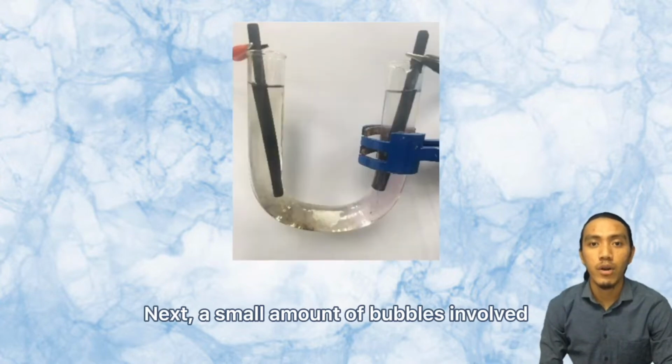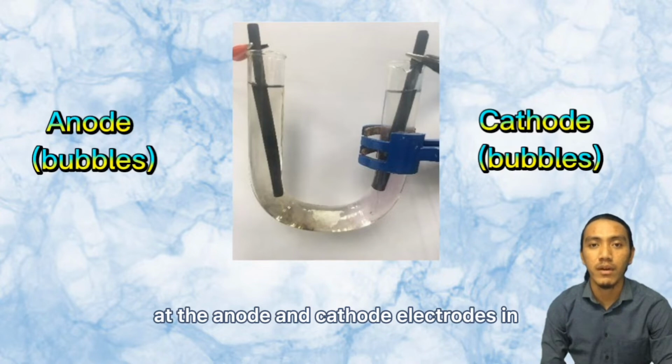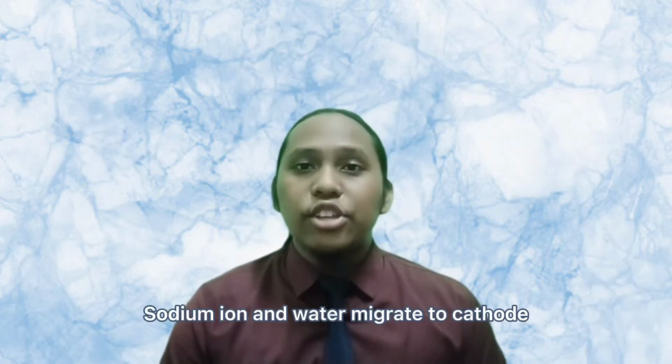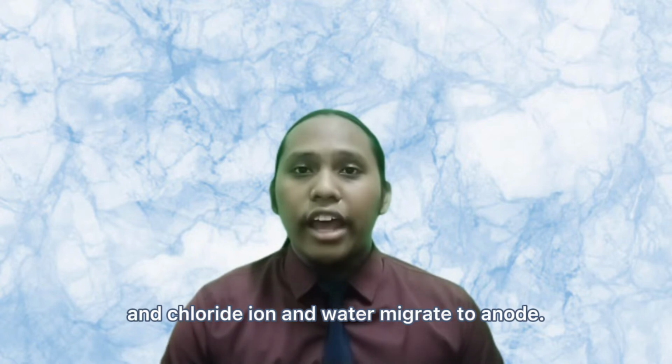Next, a small amount of bubbles is observed at the anode and cathode electrodes in 0.001 molar of sodium chloride. Sodium ion and water migrate to the cathode, and chloride ion and water migrate to the anode.